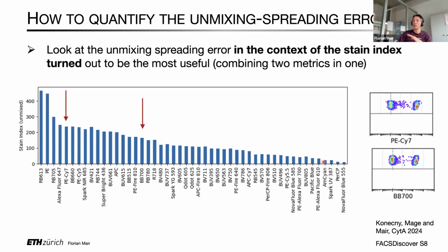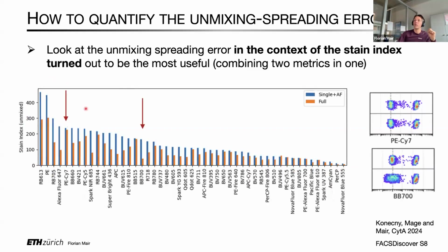And I won't be going now through the entire table that we have here, but just focus on these 2 where we have the red arrows here. What you can see then over here is the raw data. Again, the same plots as I showed you in the previous slide, where the upper row is unmixed as single stain, lower row unmixed as 50-color unmixing, but still the same raw data. And here the same for Brilliant Blue 700. And as becomes evident from the plots, and also here from the stain index, you can see that, for example, PE-Cy7, in the context of that unmixing matrix that we are having here, is a fluorochrome that is virtually unaffected. So stain index remains the same.